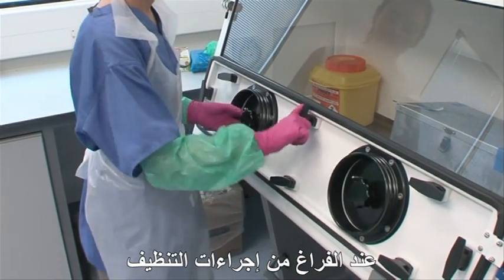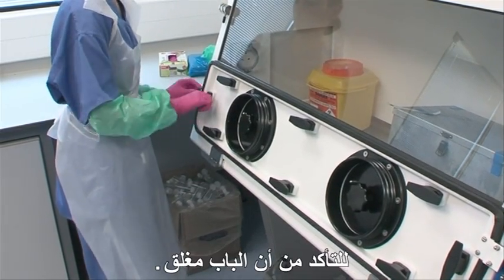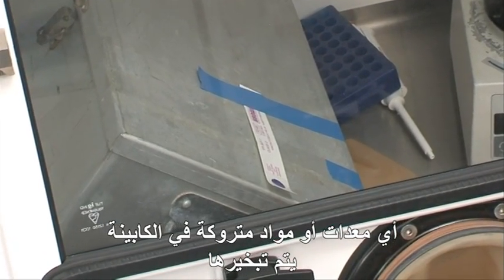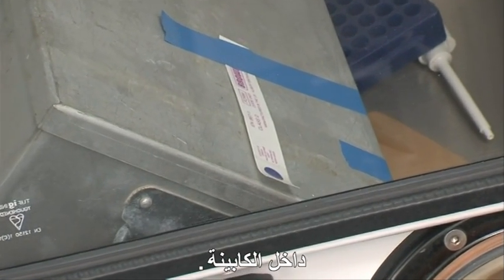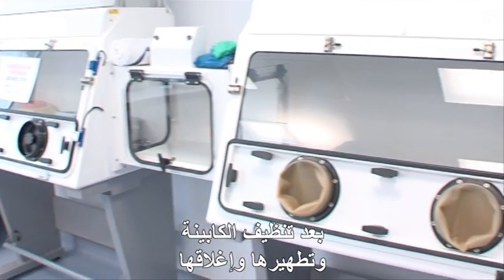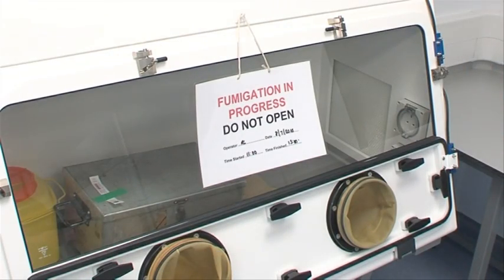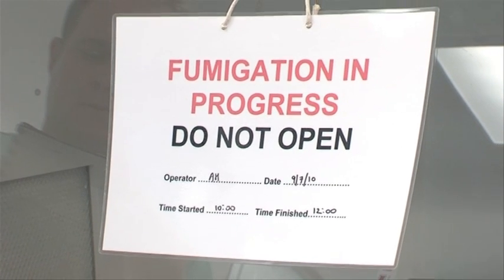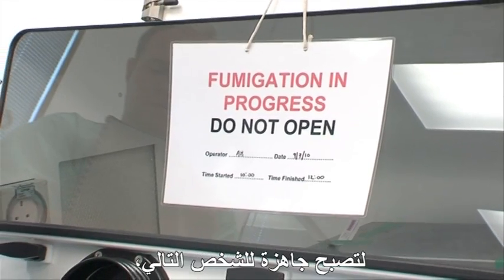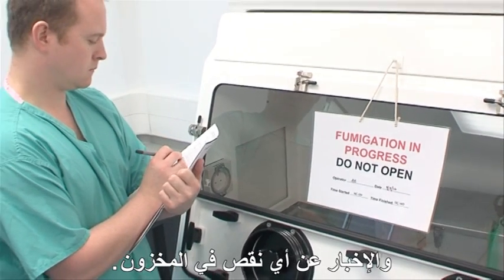When the clean-up procedure is complete and the cabinet is shut down, it should be given a final visual check to make sure that the door is secure. Any equipment or matter left in the cabinet should be fumigated in the cabinet. Once the cabinet has been cleaned, decontaminated and shut down, signage should be put in place to indicate the status of the cabinet. Once the working area has been cleaned and decontaminated and is ready for the next person, all required log books must be completed and any low stocks notified.